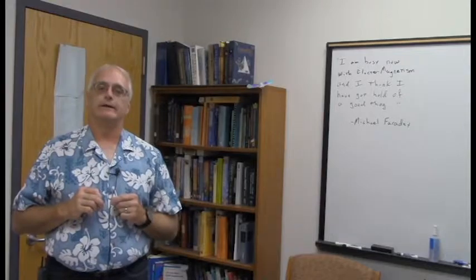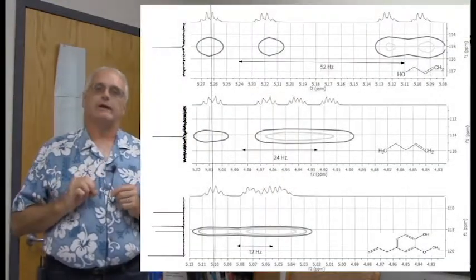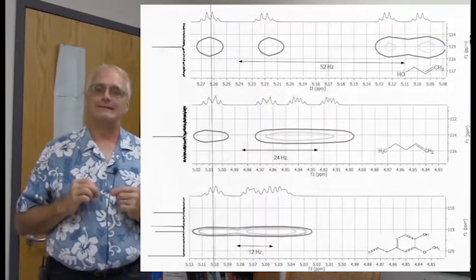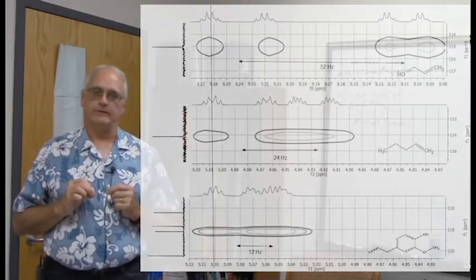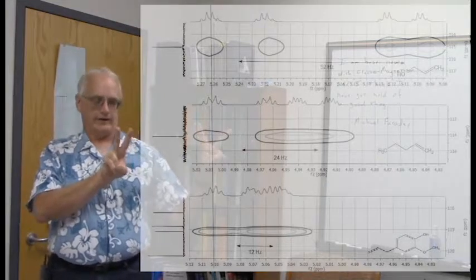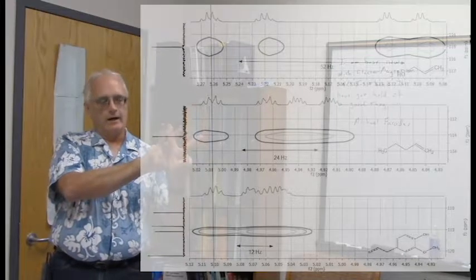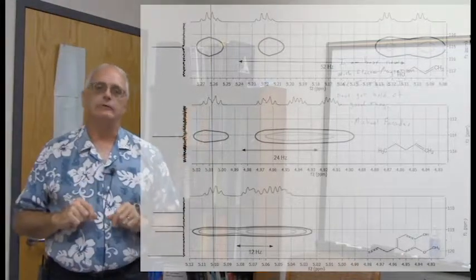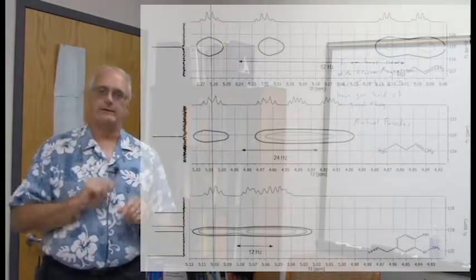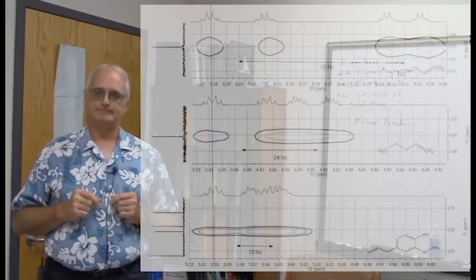To try to tie it all together, I put together this graphic where I stacked the trans and cis terminal alkene protons from the three example molecules on each other and referenced them to one of the peaks, so you can see the differences, how in the propenol they are once again nicely separated from each other, and in the pentene they're getting closer together, and then finally starting to overlap each other in the eugenol example, where they're over 52 hertz apart in the propenol and down to within the size of the coupling constant here in the eugenol.